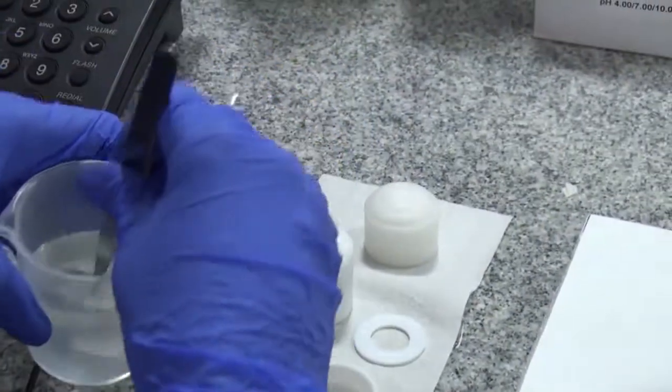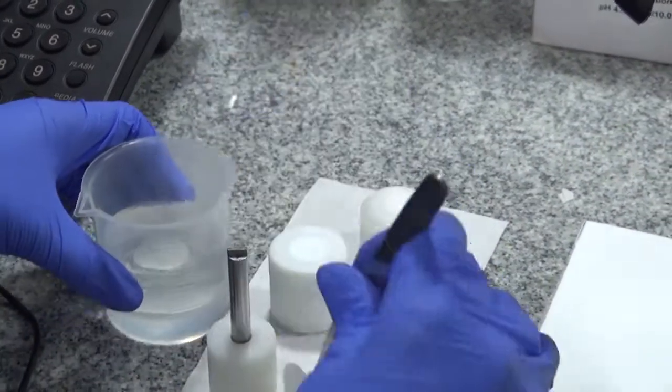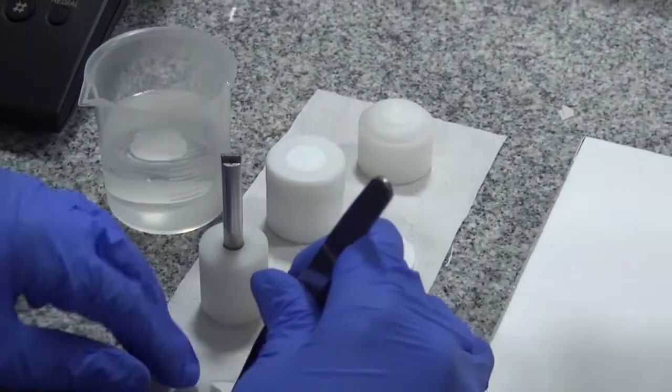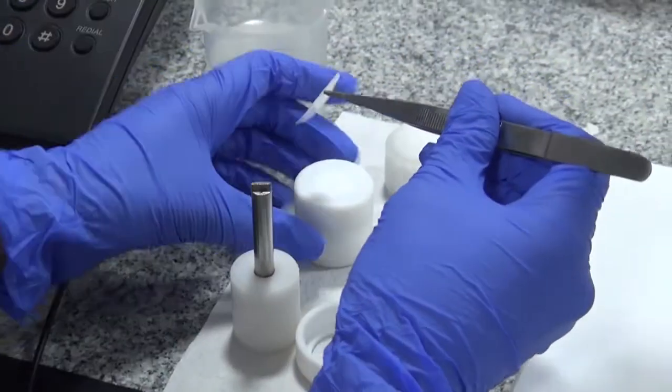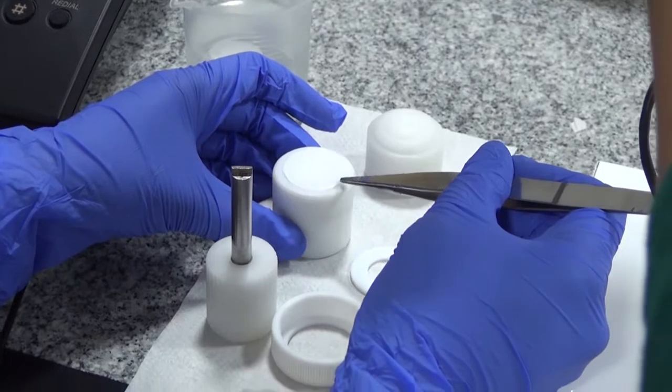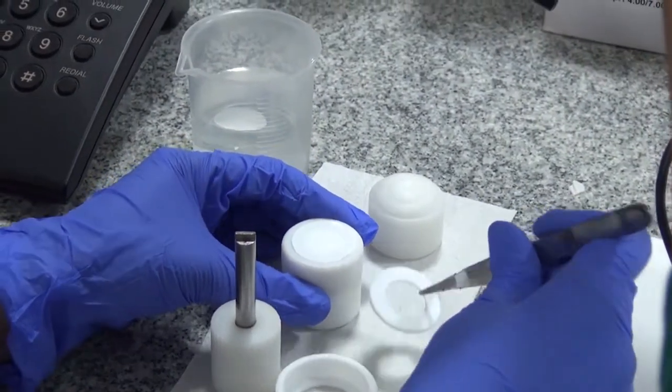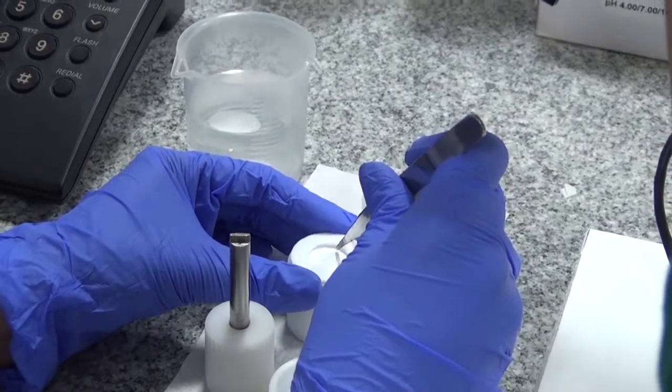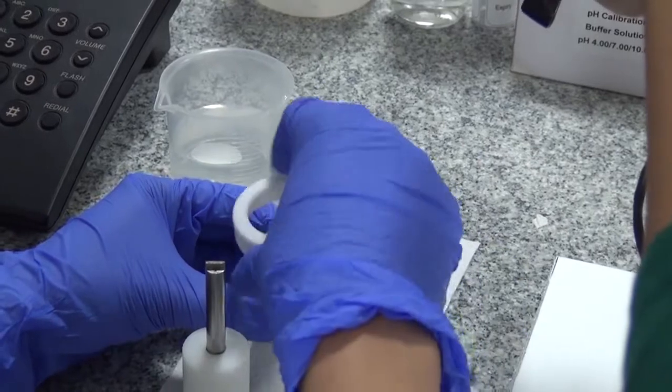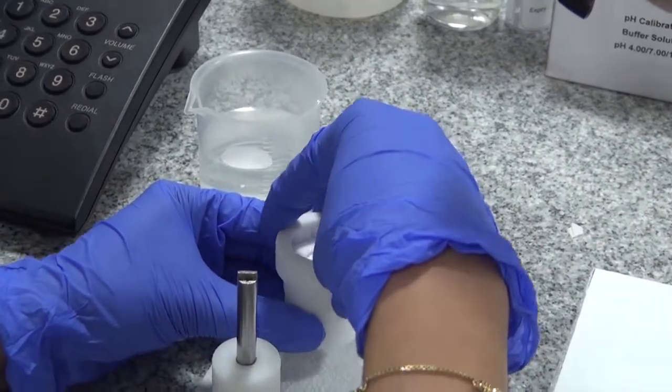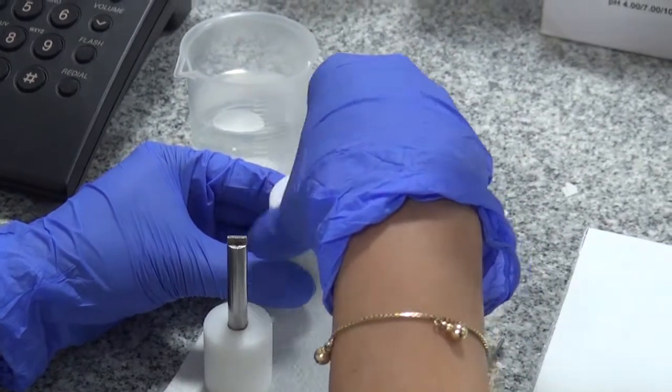We take a membrane and place it gently on the ointment. We then take the washer and place it on the membrane. After the washer, we screw on the alignment ring. At this point, we don't tighten it all together.